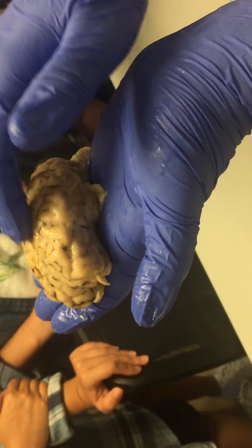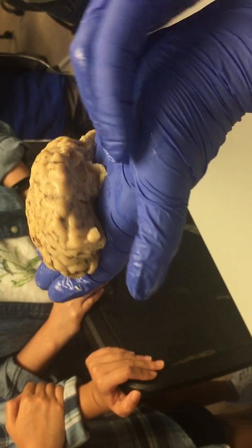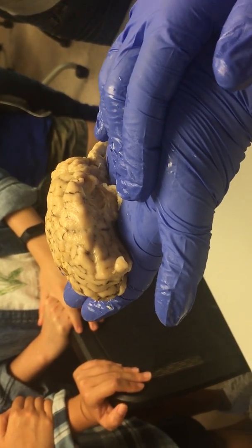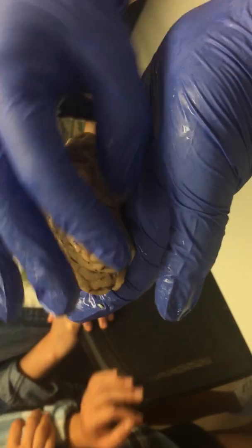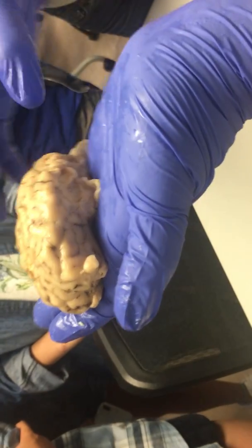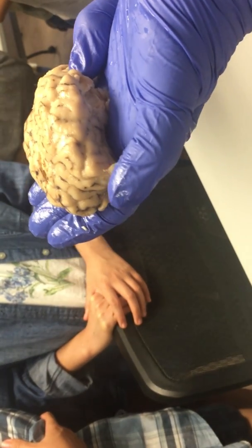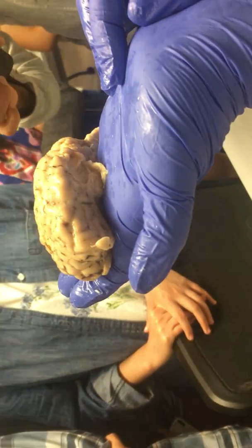And what does the cerebrum do? What's your frontal lobe do? Decision making, impulse control. There's not a lot of decision making going on. A lot of your cerebrum is used for rational thought — incorporating sensory and motor information and making connections. A lot of that happens in the cerebral cortex. Sheep don't do a lot of thinking. Their cerebellum, which is involved with smooth and rhythmic muscle movements like chewing and walking, is very large. Whereas their cerebrum, involved in rational thought, is not that big.